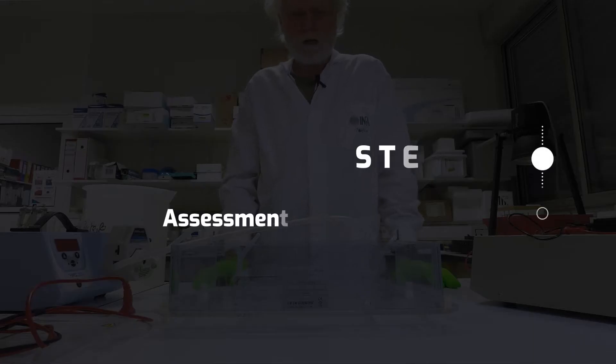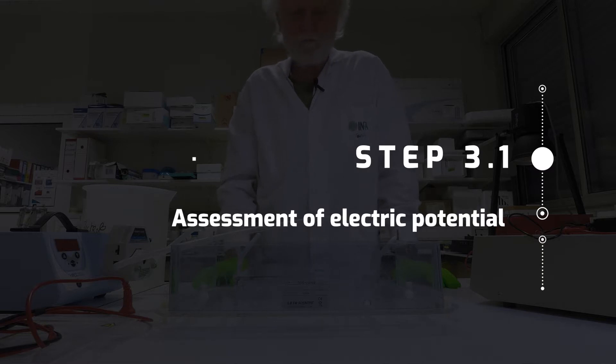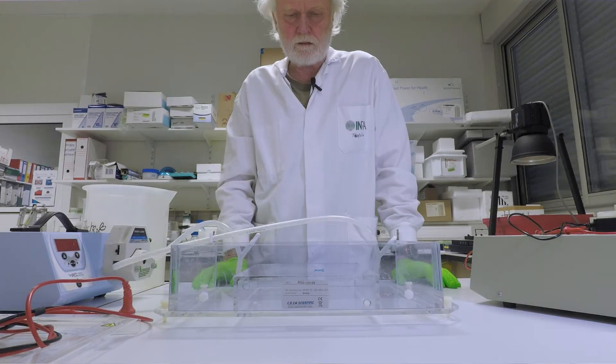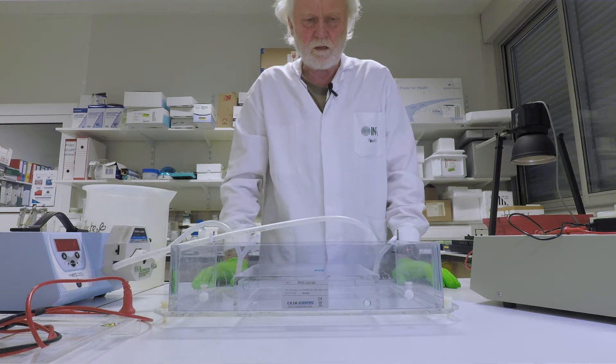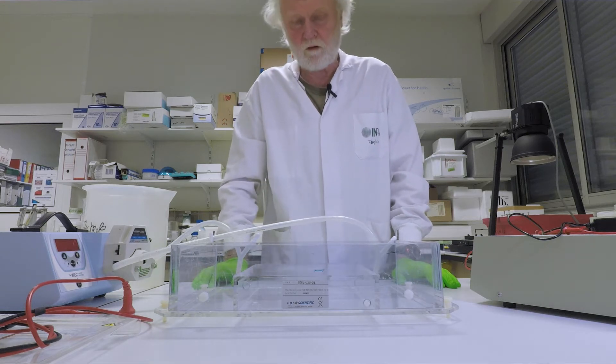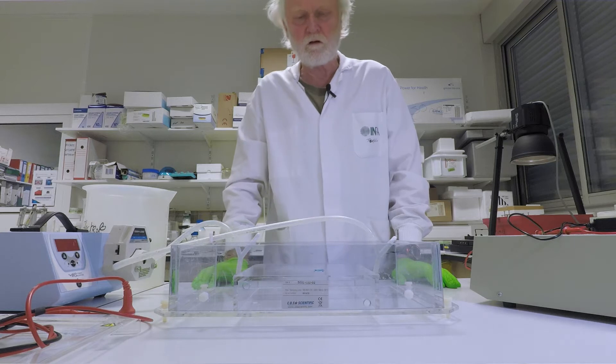Just follow and if you are in doubt as to how we do it, just review this video. We will now carry out the electrophoresis. It is quite clear that this is an important step which can greatly affect the results as they are recorded in different laboratories.